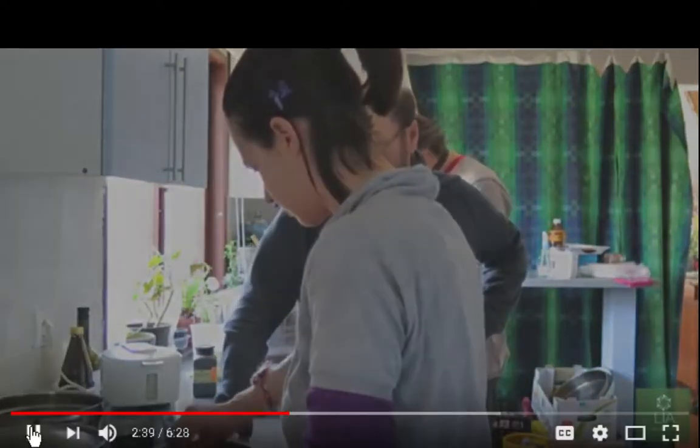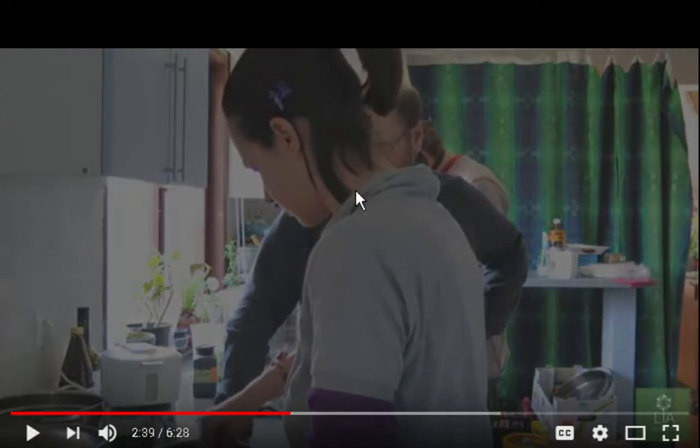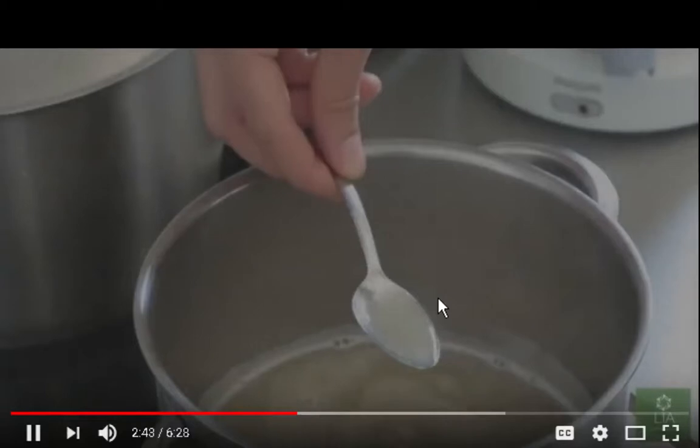Now, another thing, the person doesn't have a mask on. She doesn't have all of this gear. There's protective covering that you can use. This is not really sterile. Well, it's a clean environment. It's cleaner than my place, let's put it that way. She's got plants growing. I've got some dead plants in my house. Too funny.